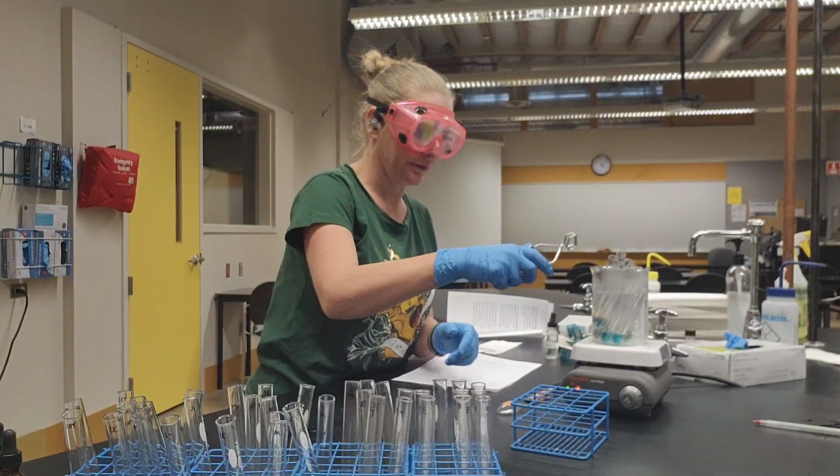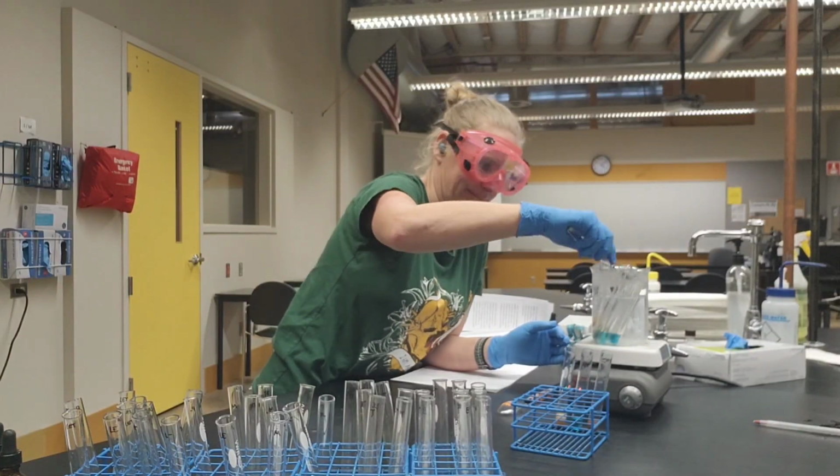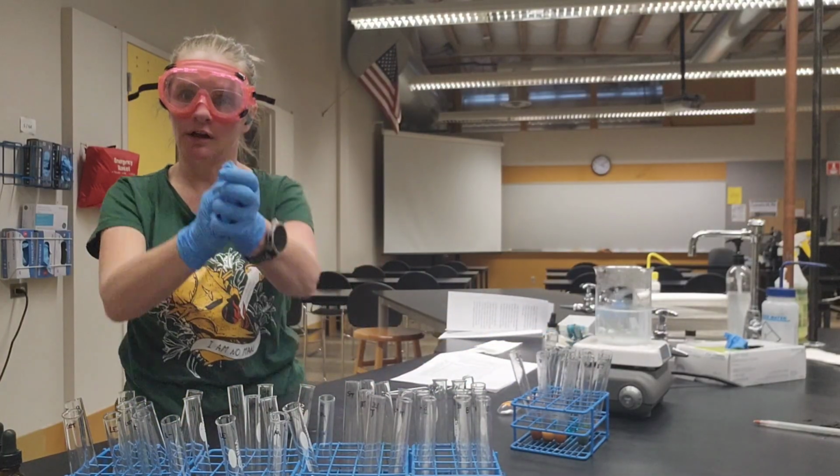Time to pull out the Benedict's. I'll show you the results.